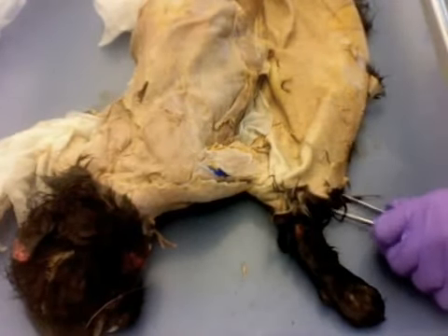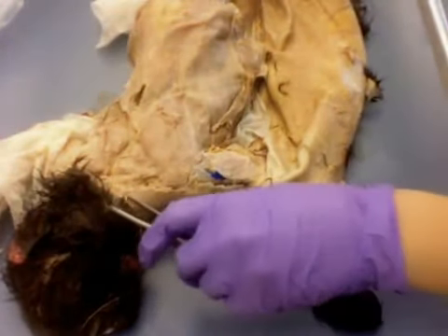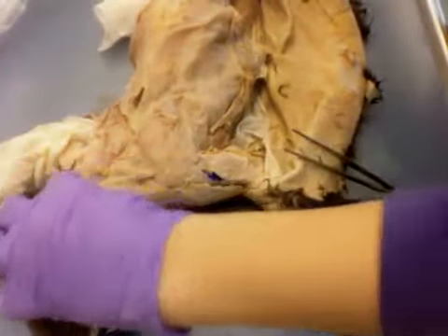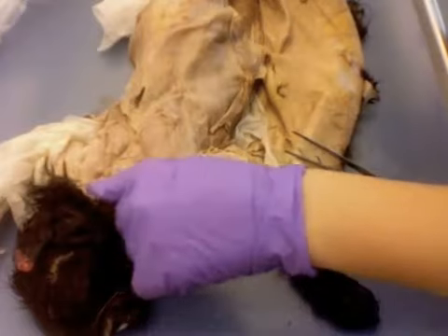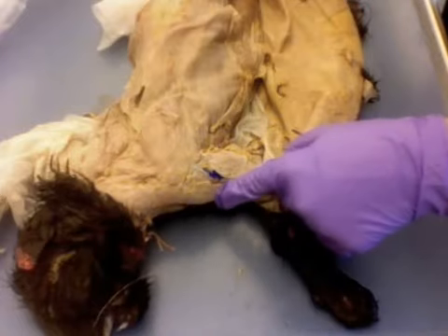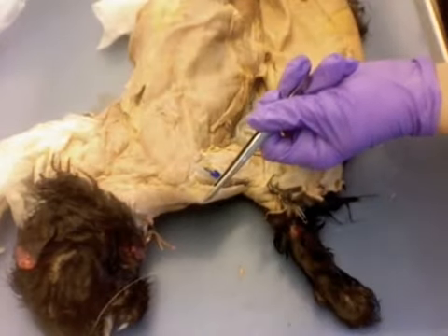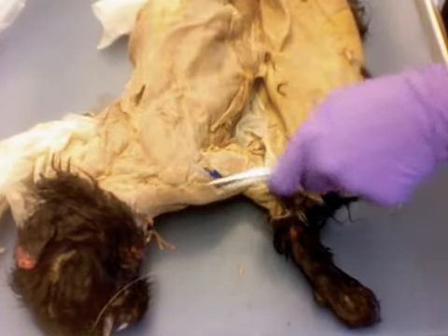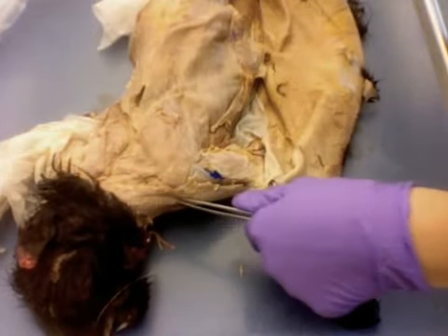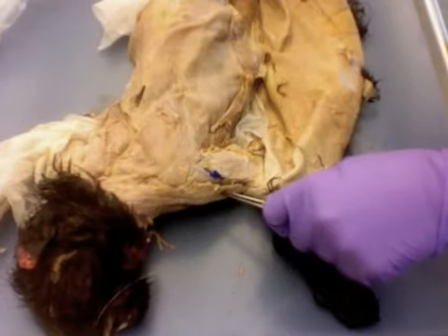Now if we flip our cat over, we can look at the superficial back muscles up here. So we have our clavotrapezius, which is this muscle. So right in here at the top of the neck there, our clavotrapezius, and then that's going to extend down into the clavobrachialis. Okay, so this muscle right here, our clavobrachialis, and this is a very continuous section here. There's not really a clear divide between the clavotrapezius and the clavobrachialis.